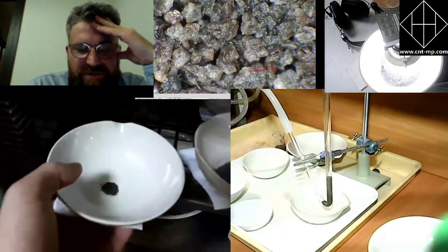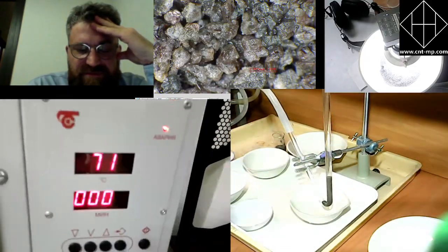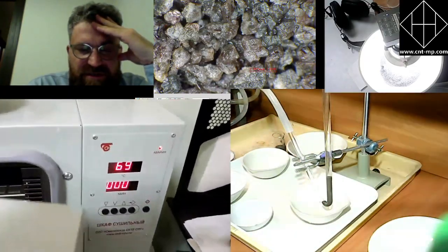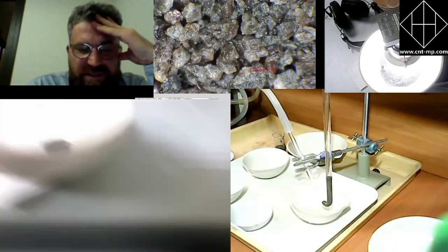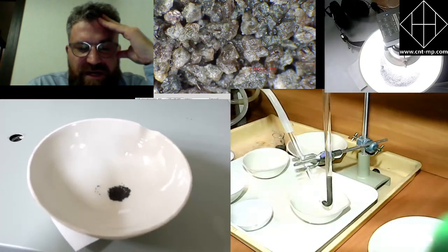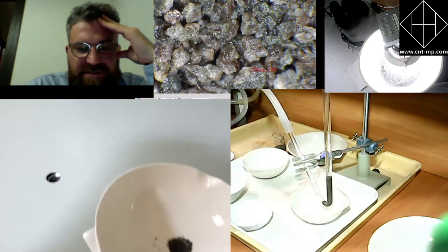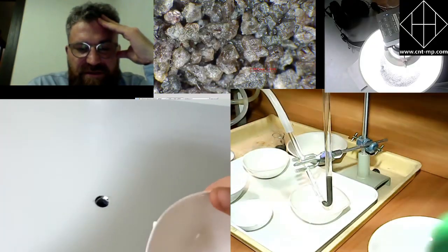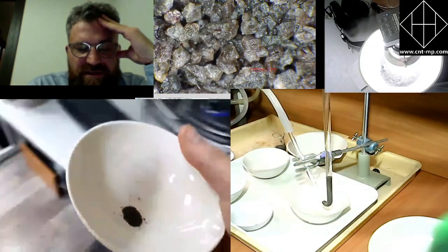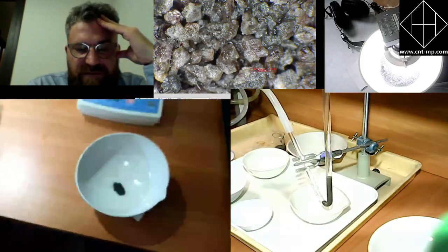Yeah, that's important to see that after tailings have been received, these tailings are put into the oven so that they dry out, at roughly 70 degrees. They dry out, and then you can treat them dry for hand picking.